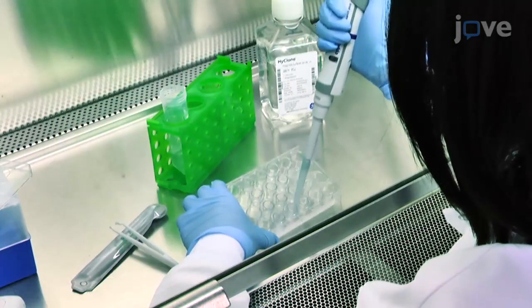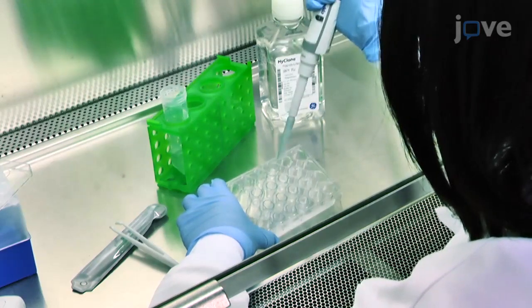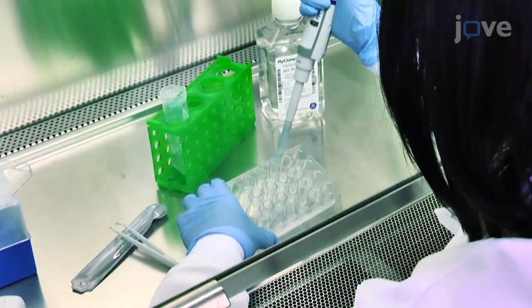After an hour, remove the collagen solution and gently wash the microporous membrane with 0.4 mL of 1X PBS buffer.